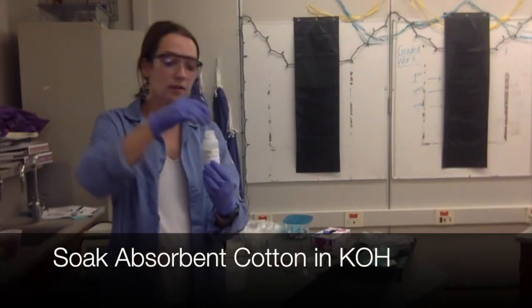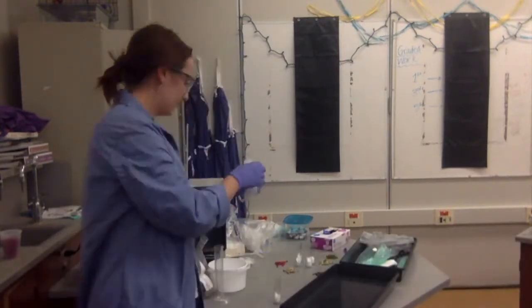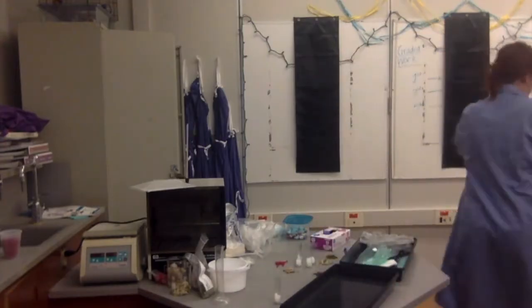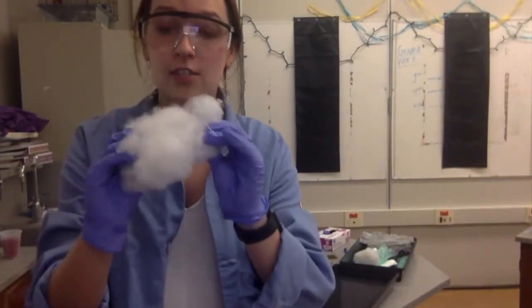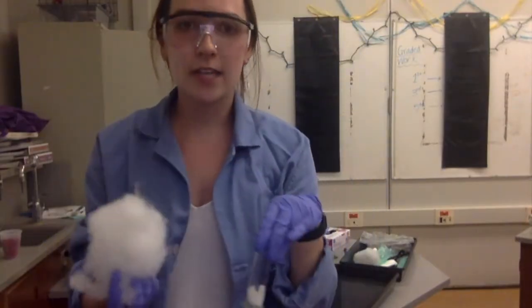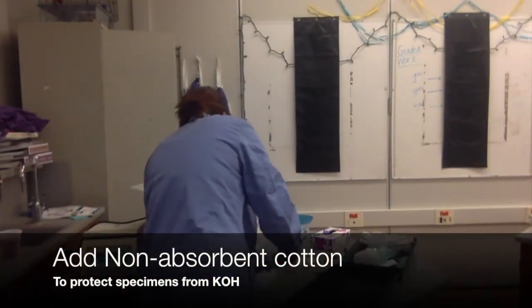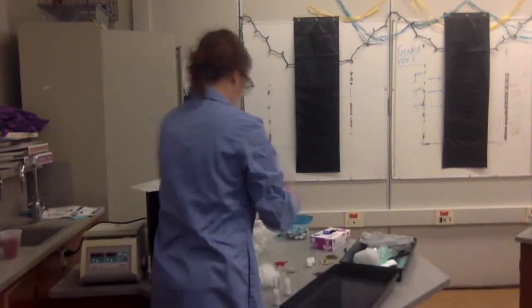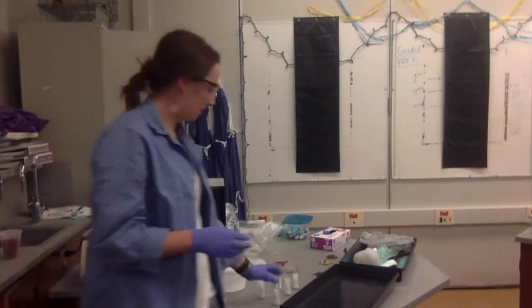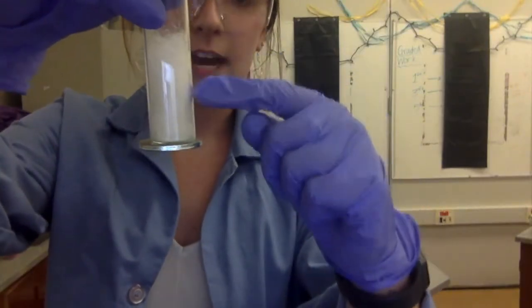We're soaking the absorbent cotton at the bottom of our respirometer setup with potassium hydroxide. Then I'm adding non-absorbent cotton on top of the potassium hydroxide-soaked cotton. This is to protect our specimens and prevent them from touching the potassium hydroxide, which could be harmful. Now the respirometer is set up with the KOH-soaked cotton ball at the bottom and the non-absorbent cotton on top.